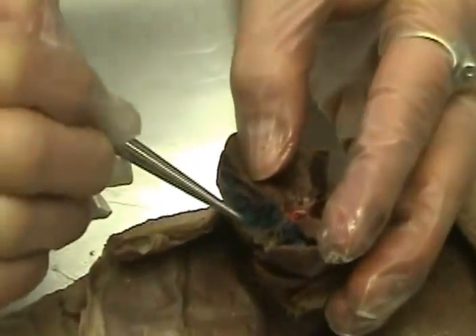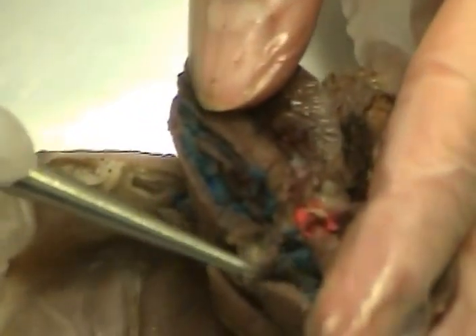Try right, sorry. The tricuspid valve has three cusps. It has a ventral cusp on the top, a lateral cusp on the bottom. There you can see it, it's kind of ripped. And a dorsal cusp on the bottom and a lateral cusp on the side. From the tricuspid valve, it goes to the right ventricle.